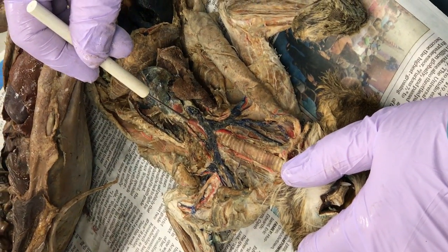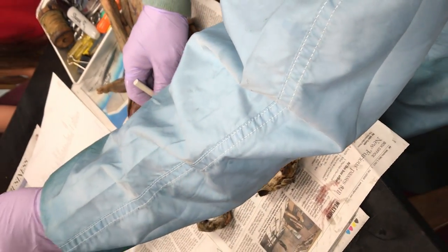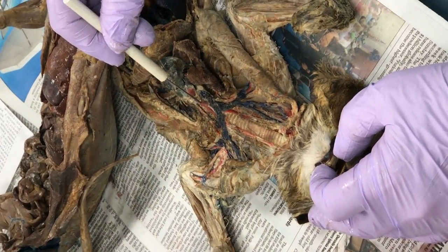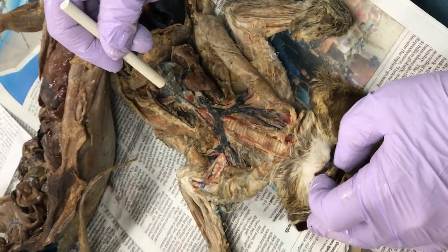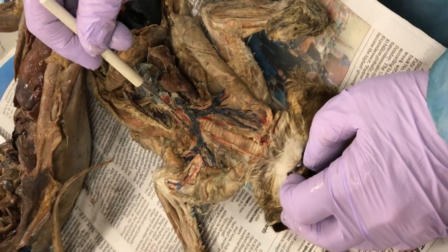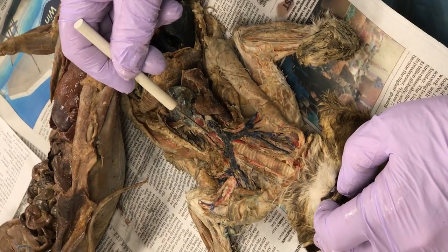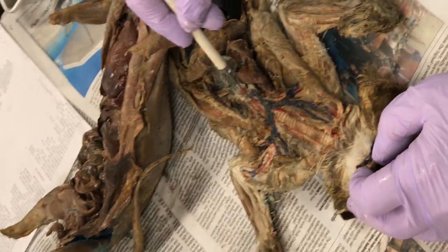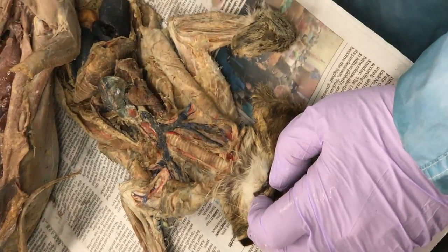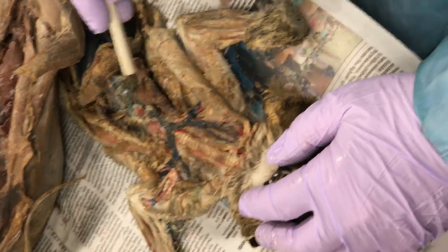Savannah, do you see that? Get up closer. Make a place — be forceful. You're short, you wouldn't be standing in front of someone else — you're shorter than those two boys, so pop in there. She can see over your shoulders. Alright, everybody get that? Innominate artery — there's only one. Innominate vein — there's two of them, one here and one here, right and left. Only one innominate artery.